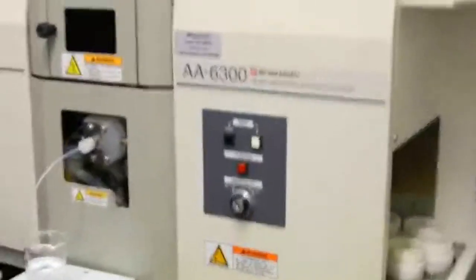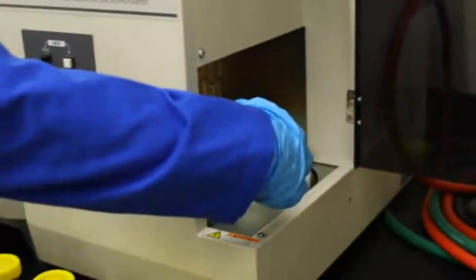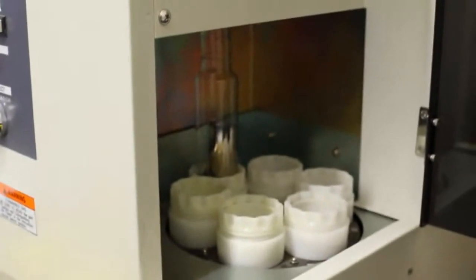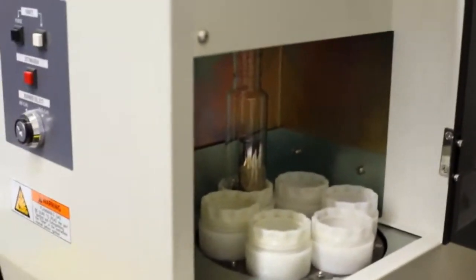Over here, let's get Alex to come around so I'm out of the way. You'll see that there is one little lamp in there, so you just need to get in a little bit. That lamp allows us to have the light going through when the flame has the colour come through, and then we get our absorptions.